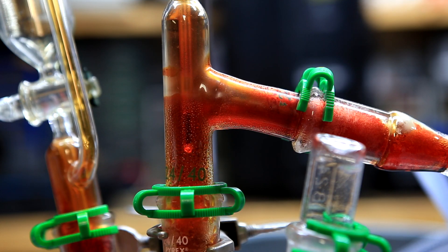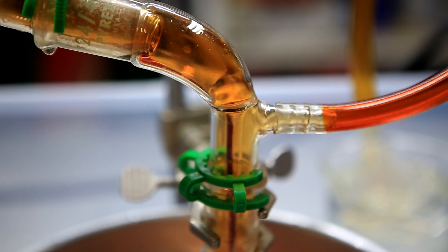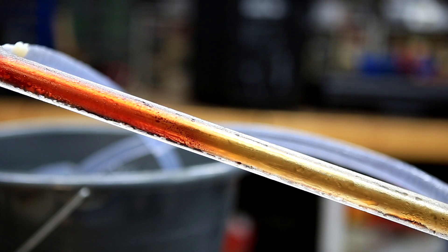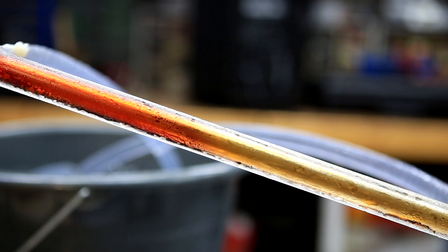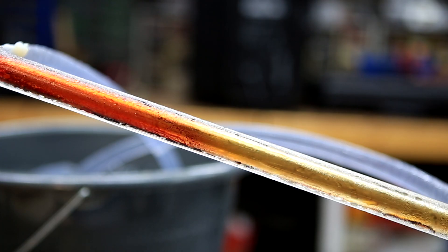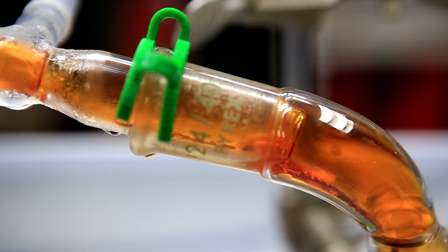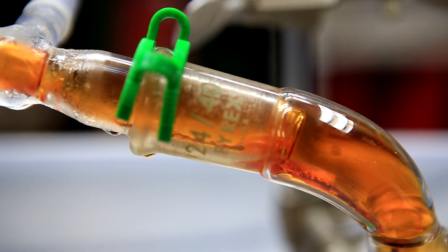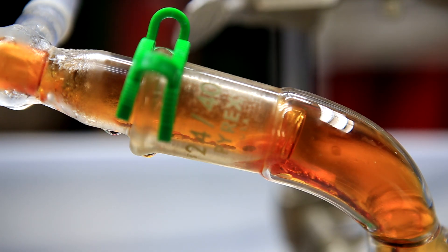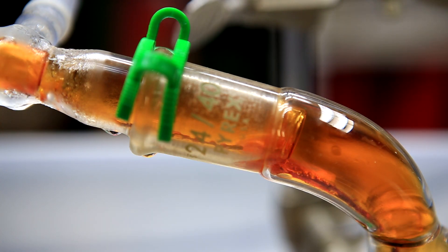Soon it will pick up and a lot of dense vapors will travel towards the condenser column. At this point, there's a relatively steady drip rate of bromine. In the condenser column, there's a gradient where the majority of the bromine is condensed to a liquid at the top. Unfortunately with bromine, it's extremely volatile and it's very hard to condense everything. Soon the rate of distillation will decrease, the temperature will rise, and more and more water will start to come over with the bromine. It's important to not end the distillation here because there is still a lot of bromine present.